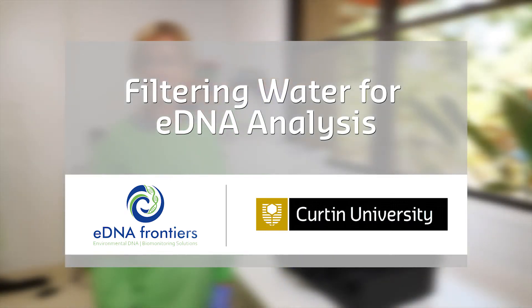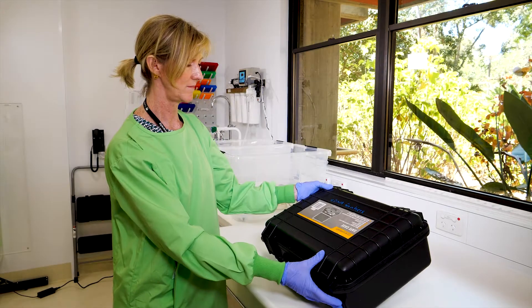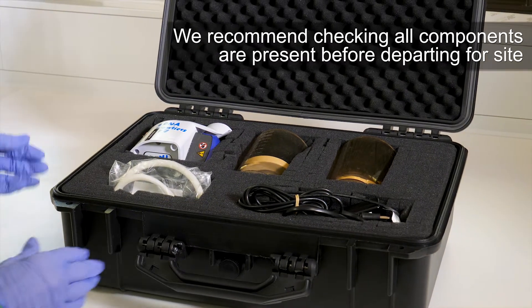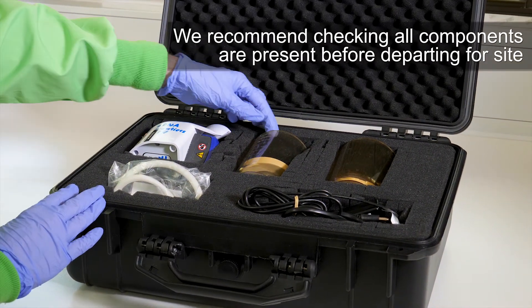We will take you through how to effectively filter them onto membranes prior to sending them to us. The filter pump is contained in the transporter pelican case. Inside is the pump, the funnels, filter base and the tubing.